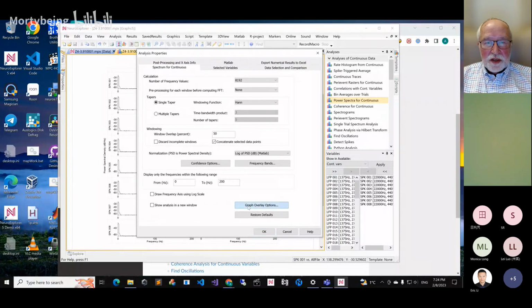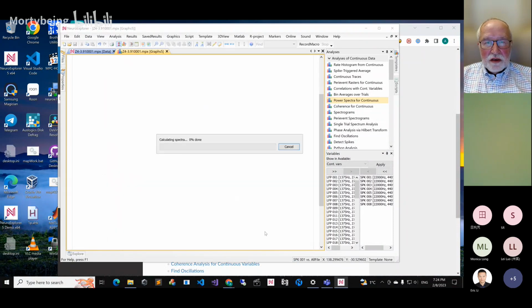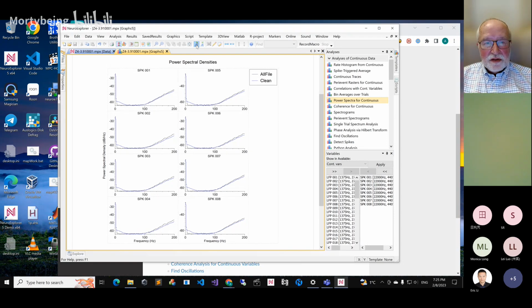But now we can also use the graph overlay option. Press here, graph overlay options, overlay graphs. Okay. So now we have two spectra for each variable. One is for all the file, and another is only from the clean intervals. So this is how you can compare analysis results from different time periods of your data.